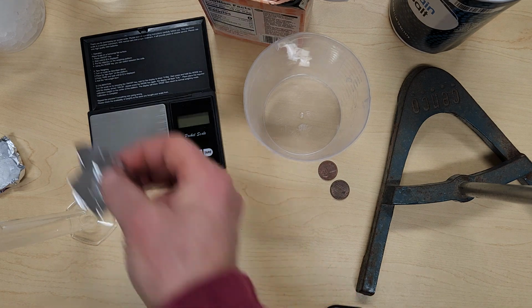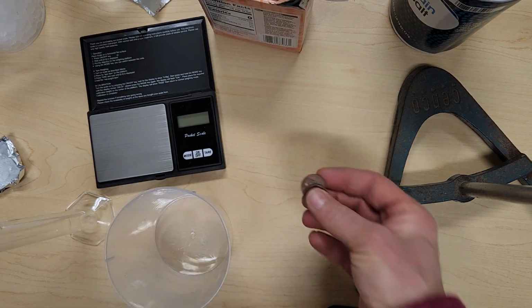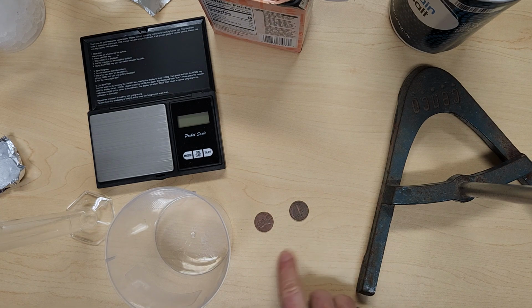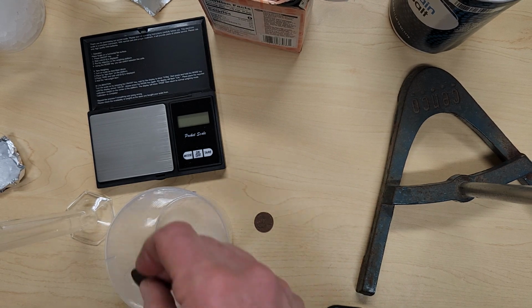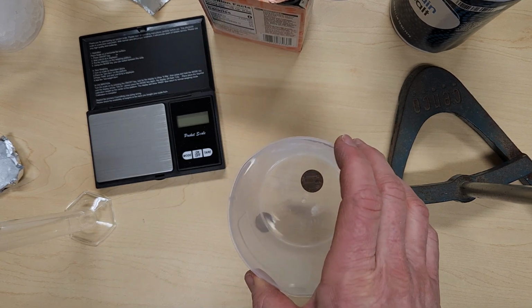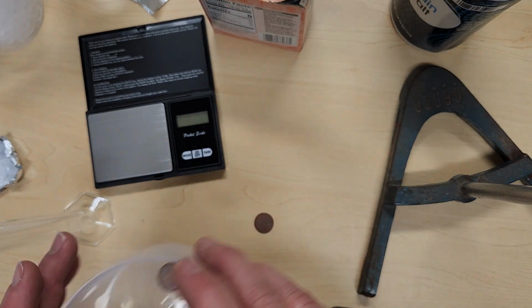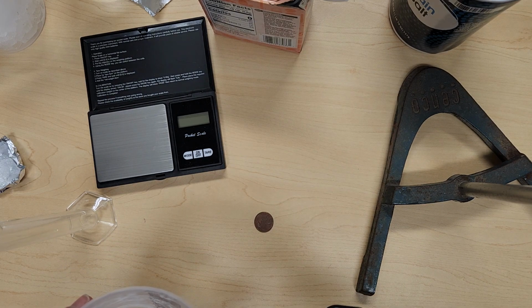Last part of the experiment, we are going to use pennies. So again, we have 2 pennies. One is going to be a control, and one we're going to do the experiment on. So we're going to add a penny into our container, add water, wait 2 to 5 minutes, see if any changes have occurred in the penny, take it out, rinse, dry it, compare it back to our control.